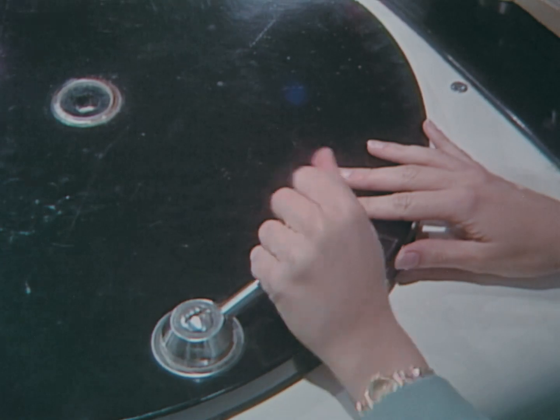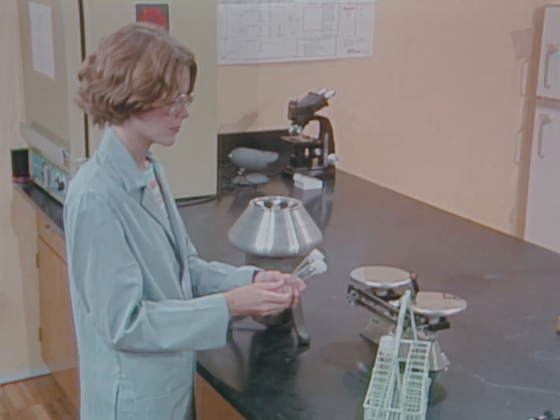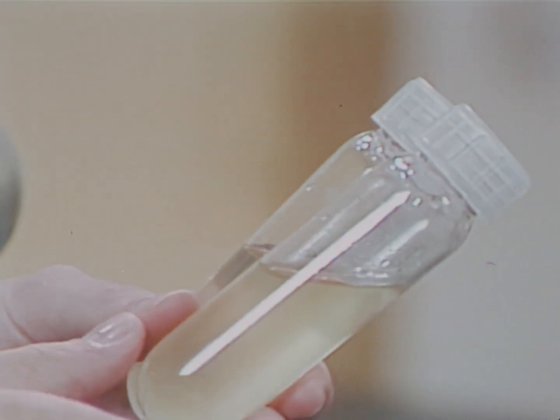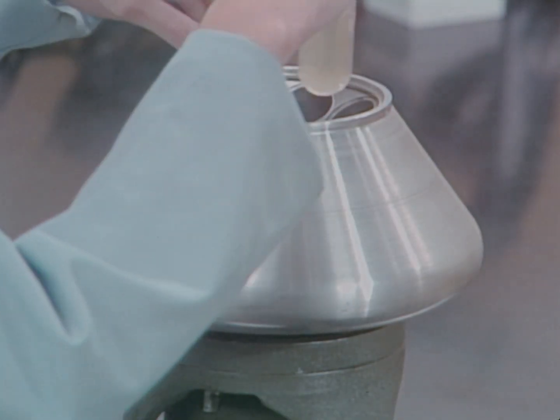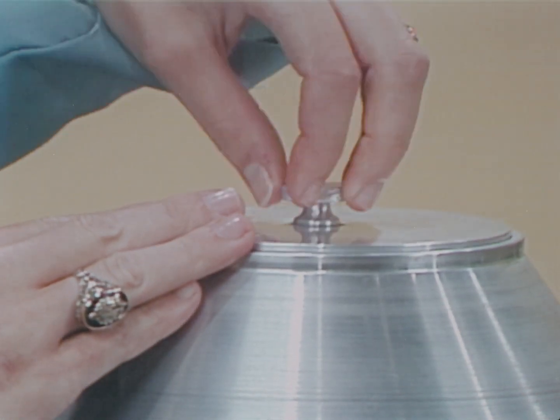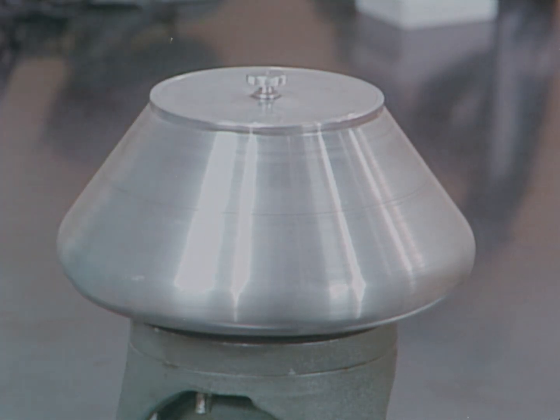We have used a bucket type centrifuge with safety carriers to demonstrate these procedures. Before beginning work with an angle head centrifuge, first inspect each tube for defects as previously demonstrated. Do not fill tubes to the top because the contents will spill when the tubes are placed at an angle in the centrifuge. You must also balance paired carriers and seal each carrier. The last step is to securely close the centrifuge cover. The same step-by-step procedure is followed with both the bucket type and the angle head centrifuge. The only exception is limiting tube contents to prevent spillage in the angle head centrifuge.